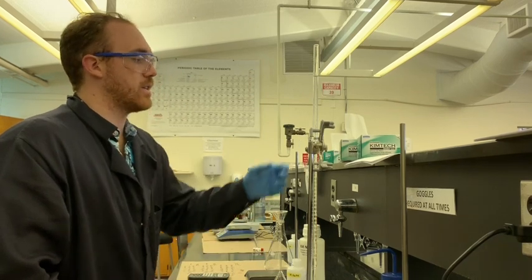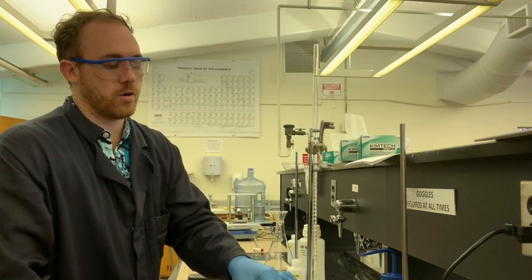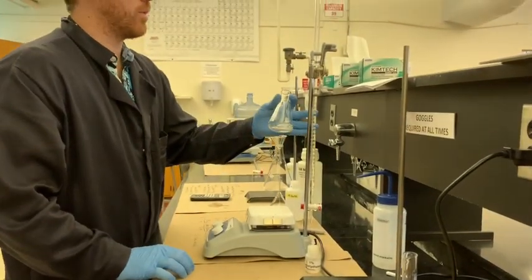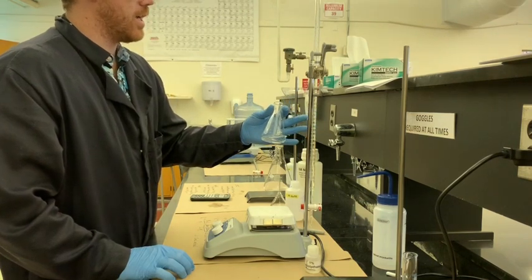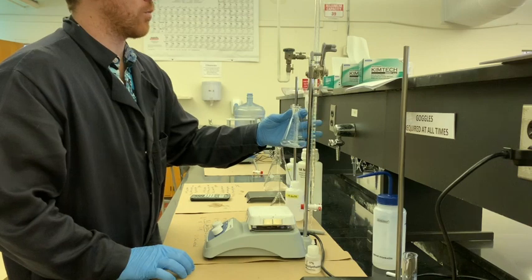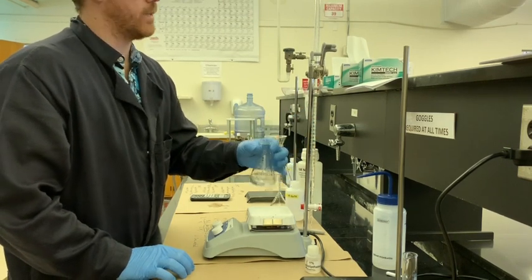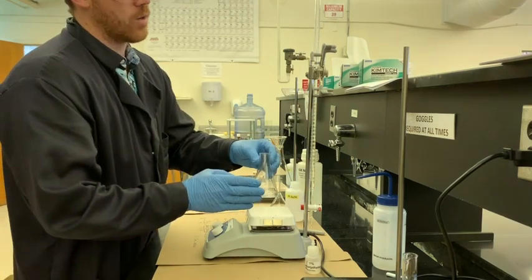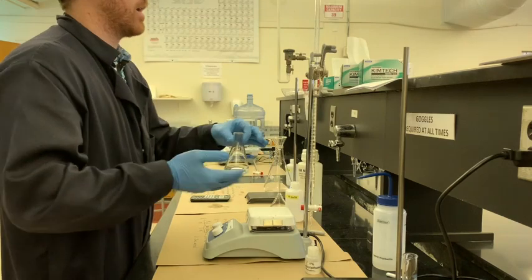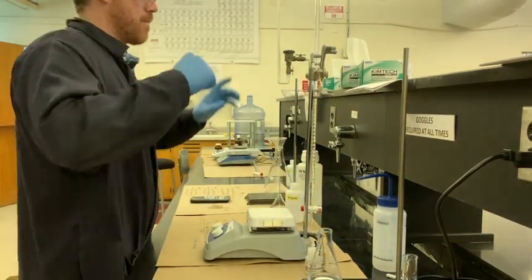Another important thing about contamination is you want to make sure that you do the filling of your burette away from your sample of KHP, just because if you spill any of the actual NaOH solution in your KHP solution, it could affect your results. Let's say in the middle of your titration you run out of the NaOH and you have to refill the burette. You should always make sure that you take the flask away so that it can not get contaminated in any way. You want to keep it as safe as possible because that could potentially affect your results.